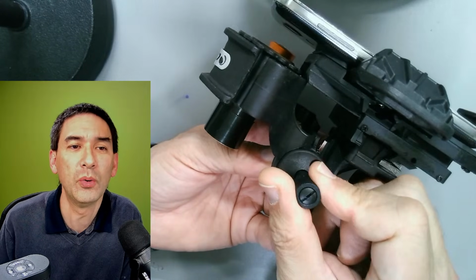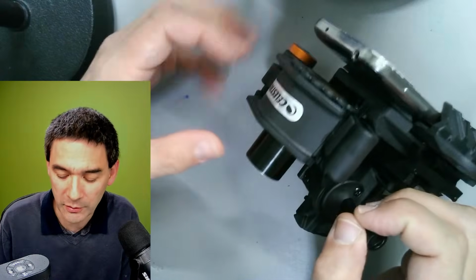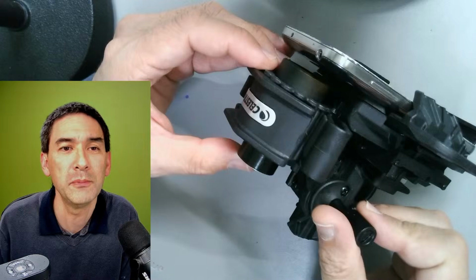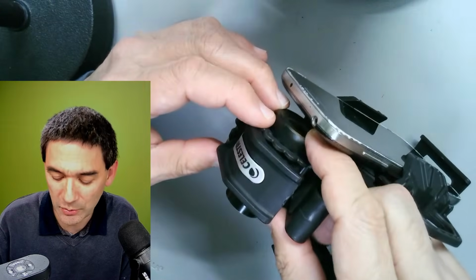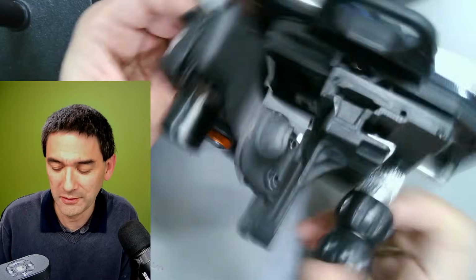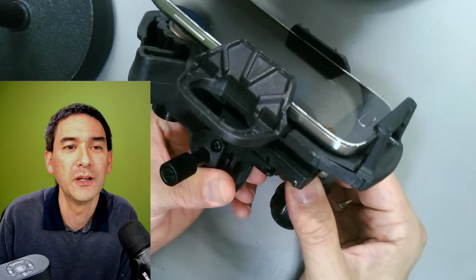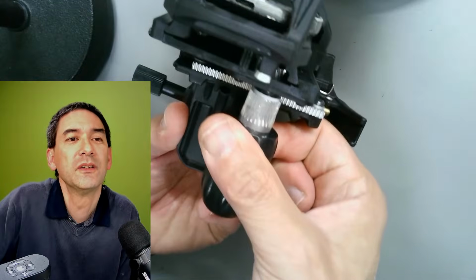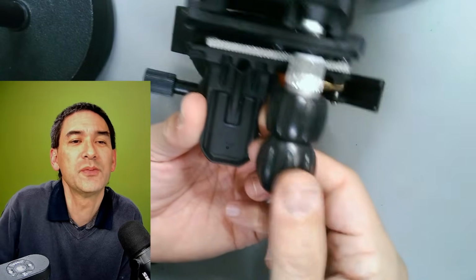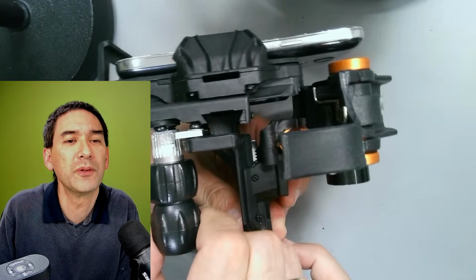If it doesn't go close enough, because maybe the distance is still too far away, then of course you have to move in the eyepiece like this. That's not a big problem either. So that's number one. And number two, look, the X and the Y axis can also be controlled. Over here by moving this, you're moving it left and right, and this one over here, you're moving it forward, backward.